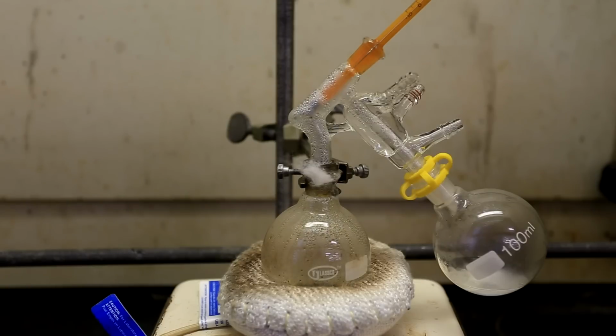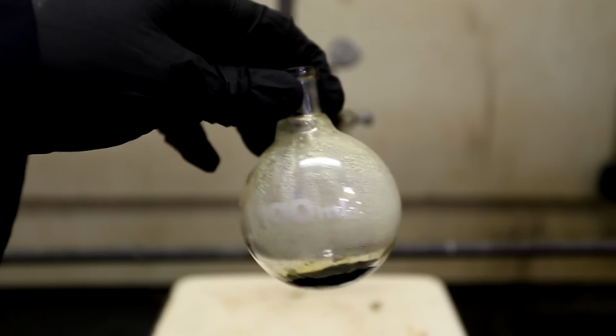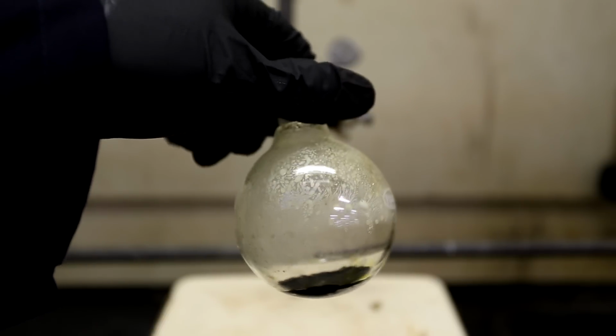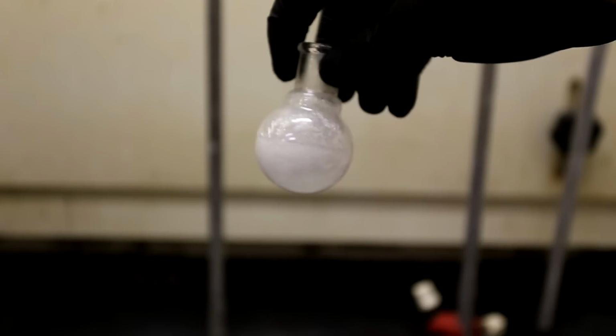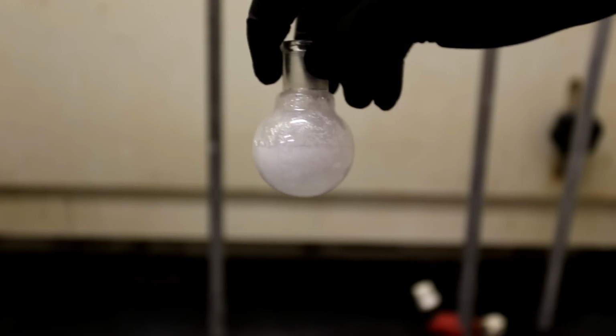Phenol is an important precursor to a multitude of chemicals. It is used to synthesize many drugs, herbicides, as well as cosmetics. It can also be used to make plastics, bisphenol A being the most notable one. In this video, we'll be making phenol by decarboxylating salicylic acid.